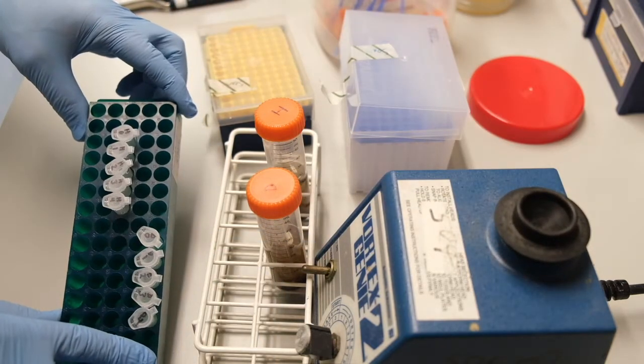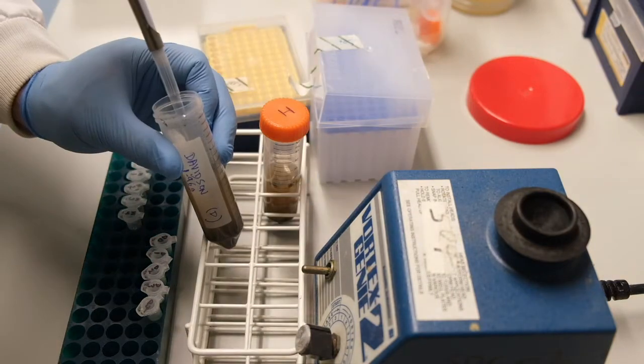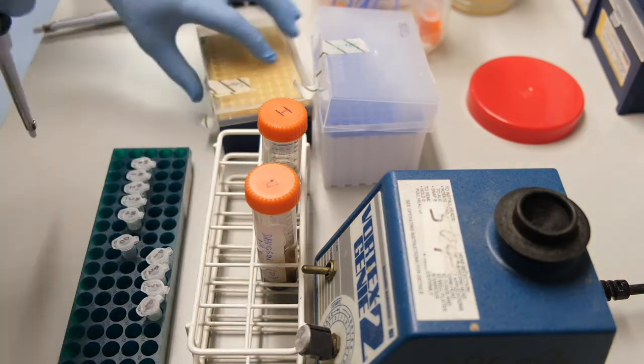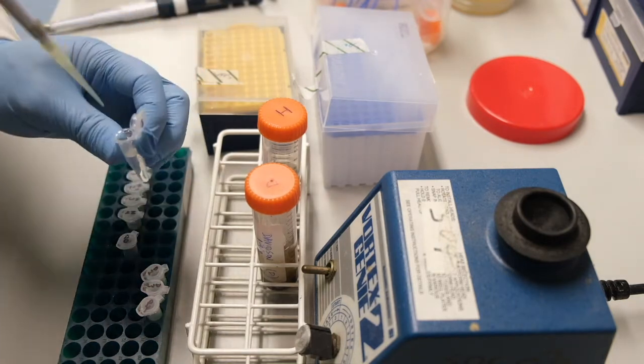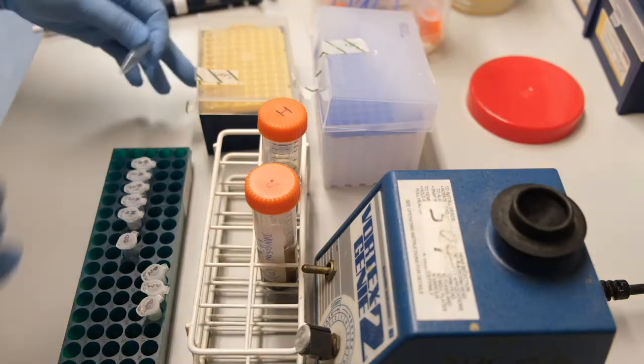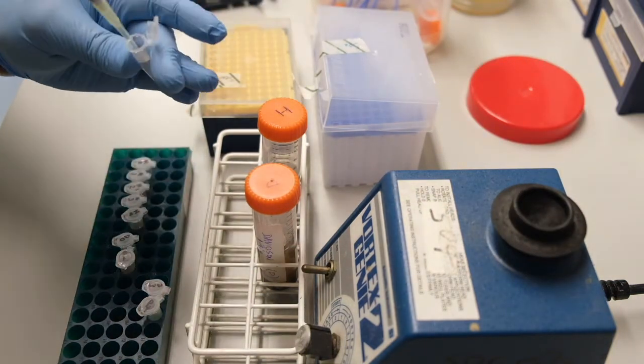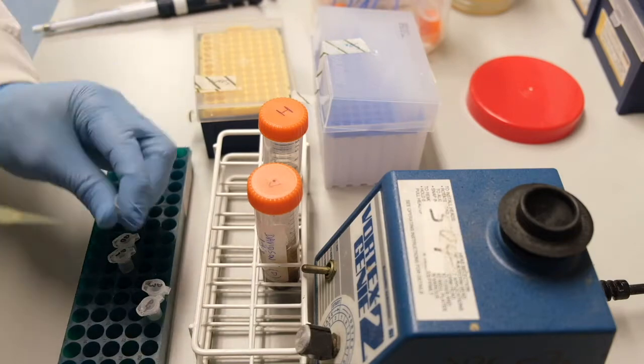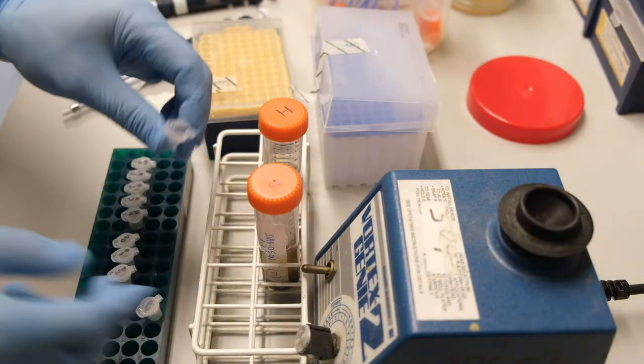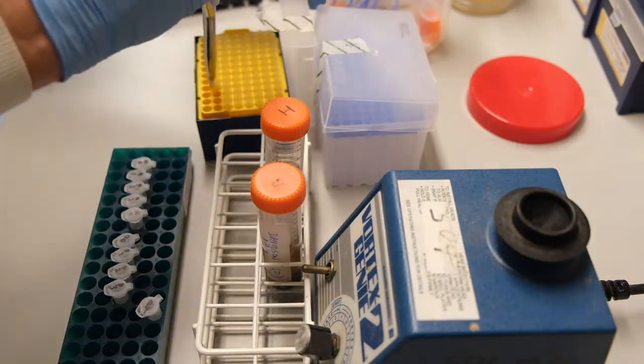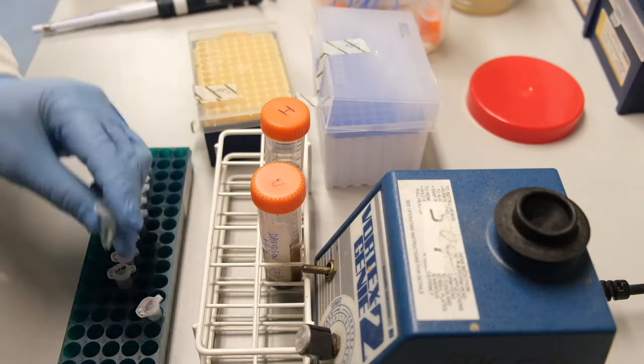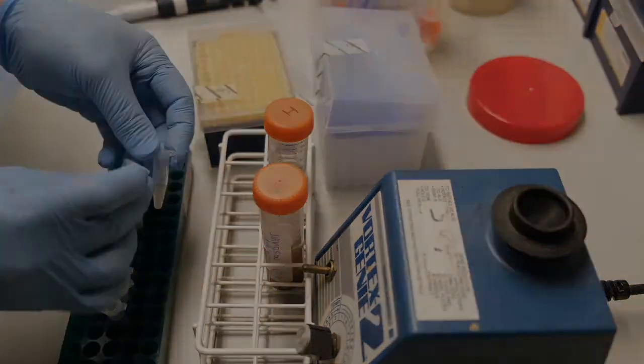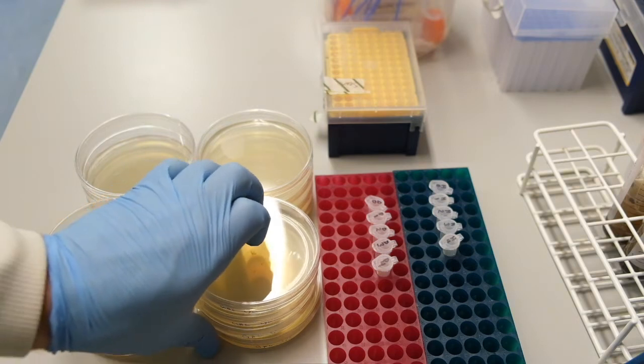I also make a set of dilutions for soil sample D. Here the action is shown sped up. We now have all of our soil sample dilutions ready.